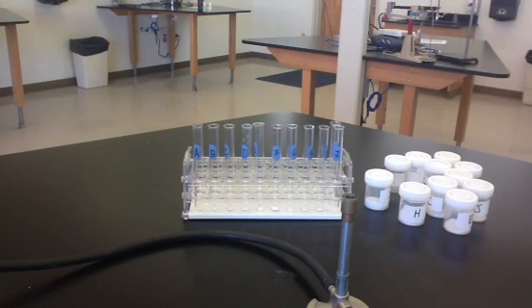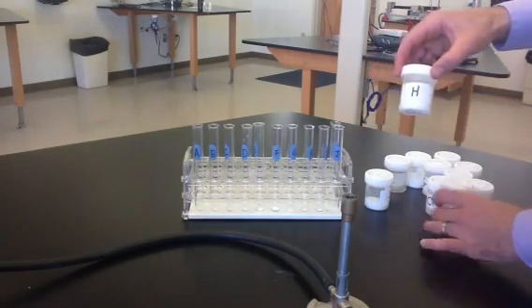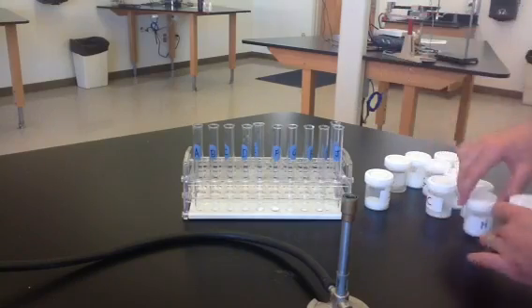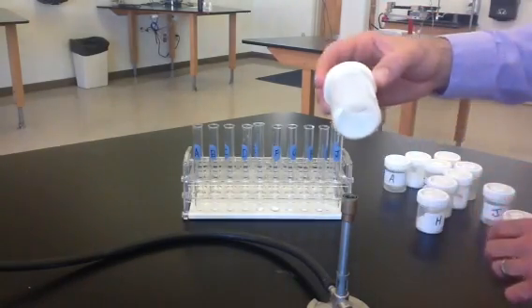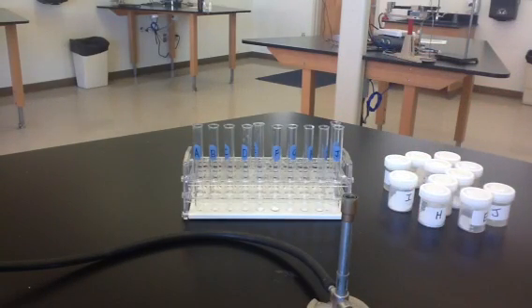This lab is the qualitative analysis of 11 unknowns. In this lab we have 11 unknowns, and they're all marked with a different letter, and each one is a white powder, so they all look kind of similar. You can tell some subtle differences in their appearance, but our goal today is to analyze them with a bunch of different physical and chemical tests and see what the identity of each one is.